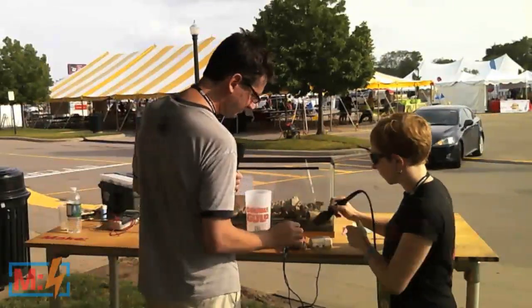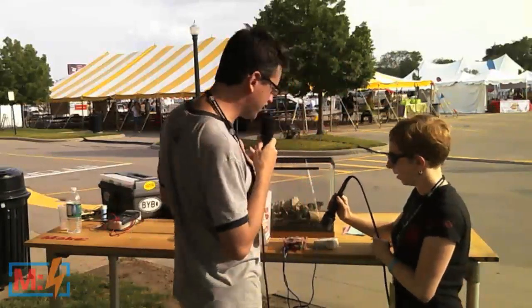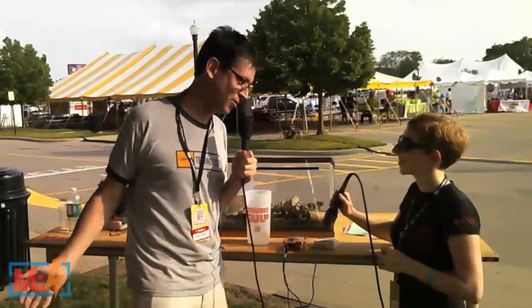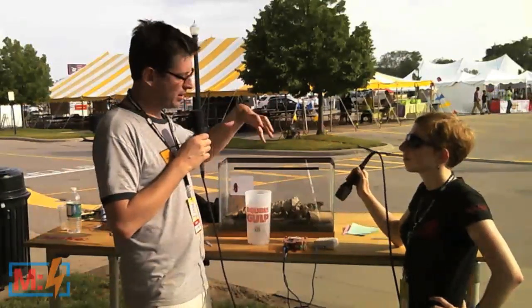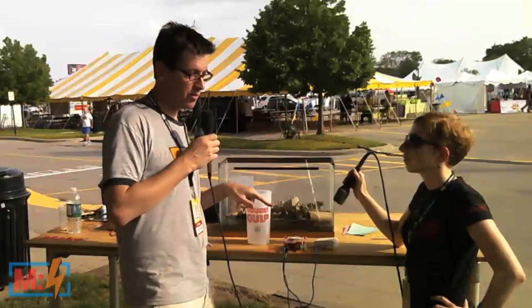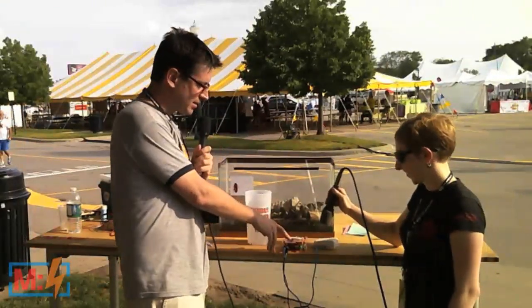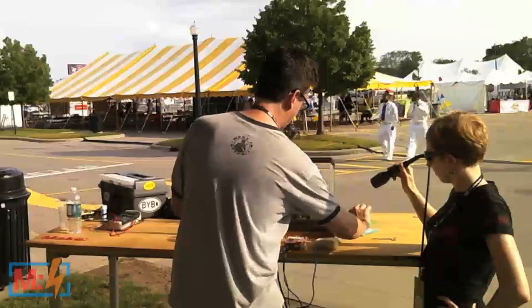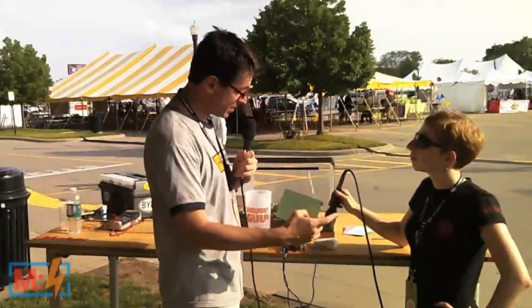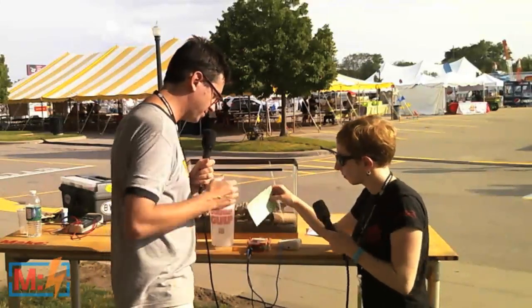What does that sound like to you? Static. Yeah, it sounds like noise to most people. But to me and to all the electrophysiologists out there, this is the most beautiful sound in the world. When we work in the laboratory, we actually take hours and hours to do a surgery, and at the end, 50% of the time we hear this noise, and that's good. What's nice about this prep is that pretty much anyone can do it — from sixth grade on up, anyone can just place pins inside there and record this beautiful thing, which is neurons. I'm making the argument that these are touch cells, which means they're going to be able to respond to touch. So I want you to take this piece of paper and brush it against the leg, and hold the microphone up so we can hear what happens.